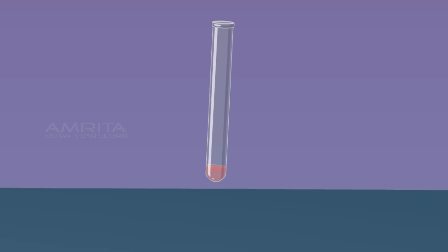Shake the test tube well. The color of the solution changes to red.